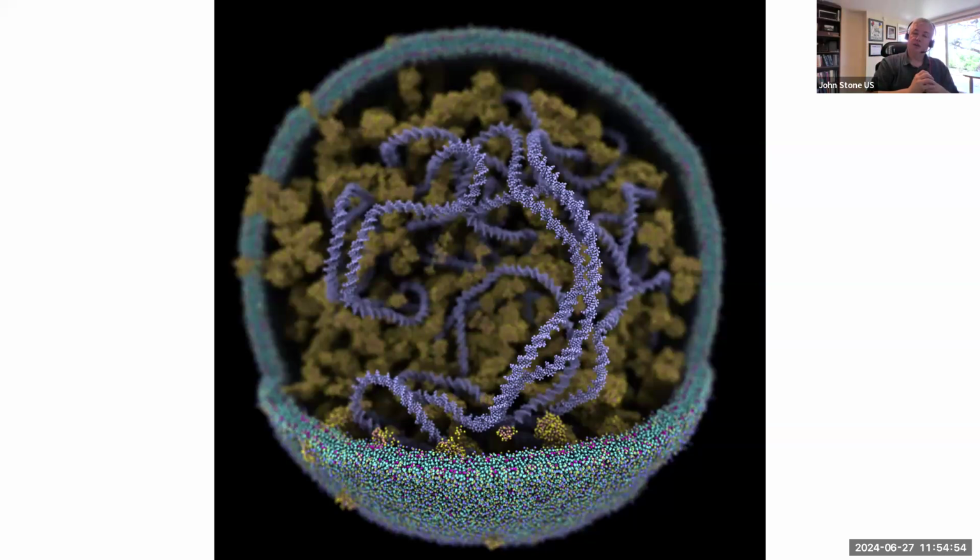And then the last one, which is the thing that's new, and that's what we were talking about with VMD 2.0, is changing the entire VMD viewport renderer, the main window, to use ray tracing. That is a new feature. If you want to compile VMD from source, this can be turned on. We have this prototype in there now, and it basically does everything using ray tracing all the time, even when you're interacting with the main user interface. The goal is that it will become part of VMD 2 by default.